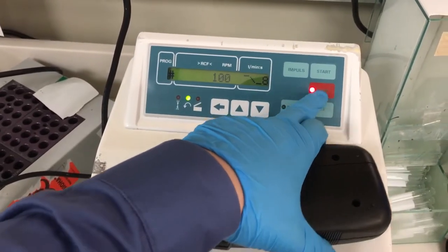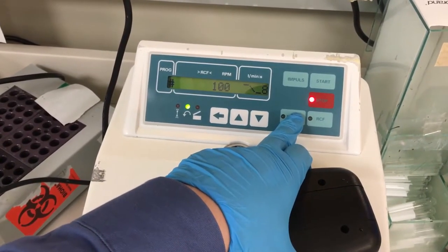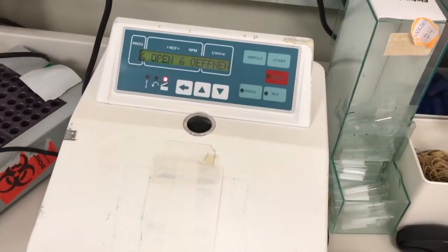Let's choose that. You can set it back now. Right, set it back. Over there. Okay, let's turn the program.